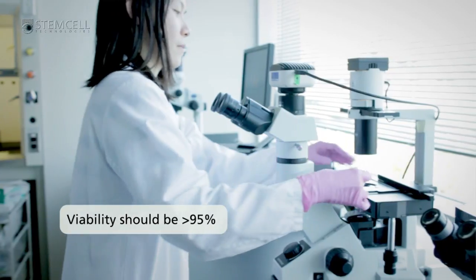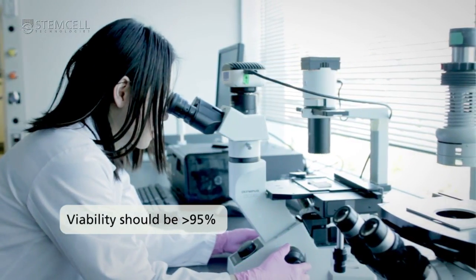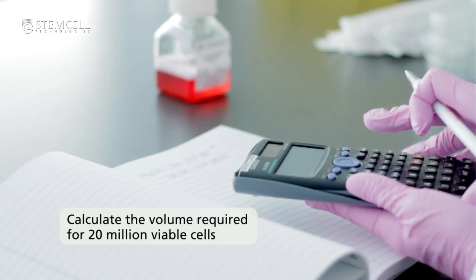Perform a viable cell count. The viability should be greater than 95%. Calculate the volume required for 20 million viable cells.